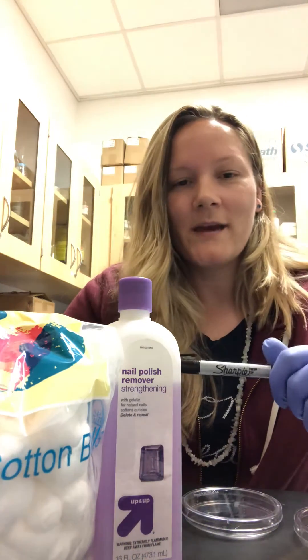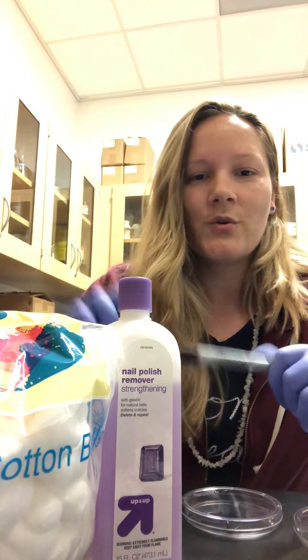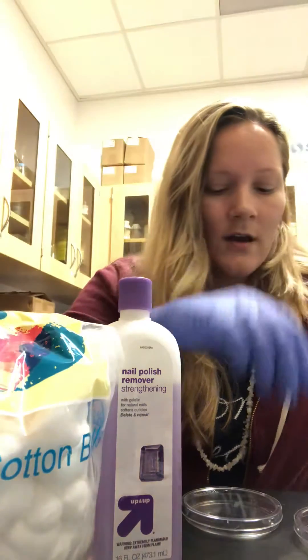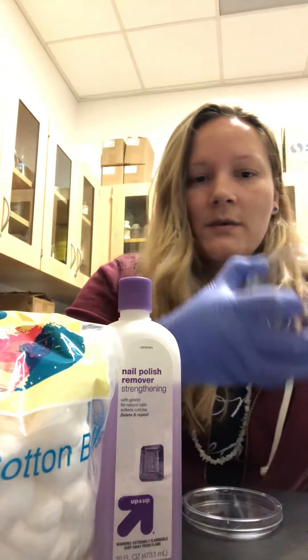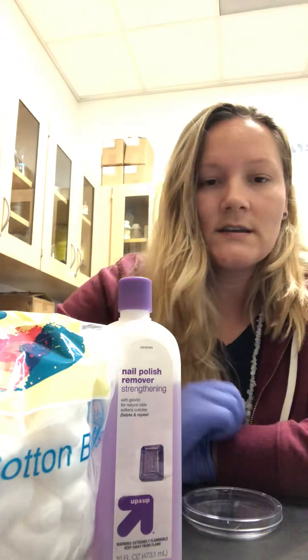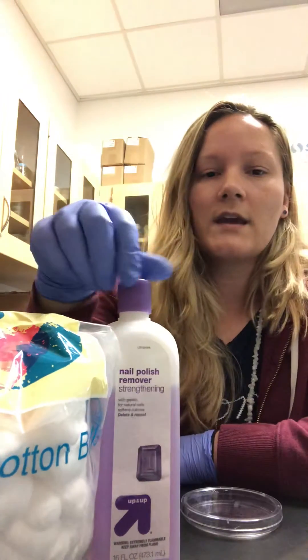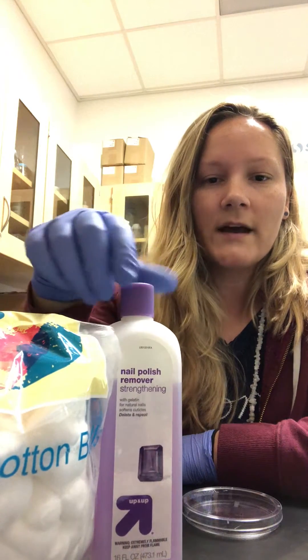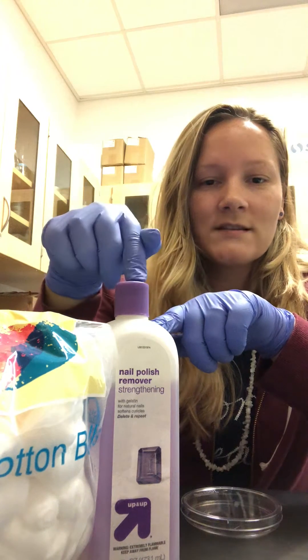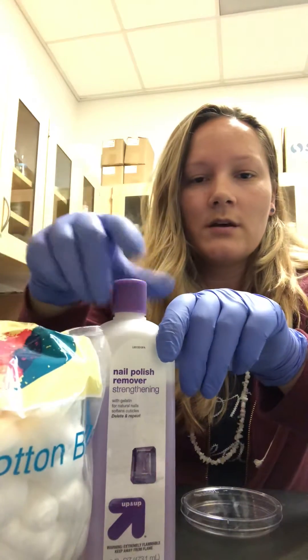Welcome back to University Lab Tech School. I'm Lori the Lab Tech and I'm going to show you how to remove a permanent marker sharpie from a plastic petri dish. The best way to do it is immediately after class. You can take any alcohol that's been lying around, or you can bring in your own acetone or fingernail polish remover from home, and use cotton balls.